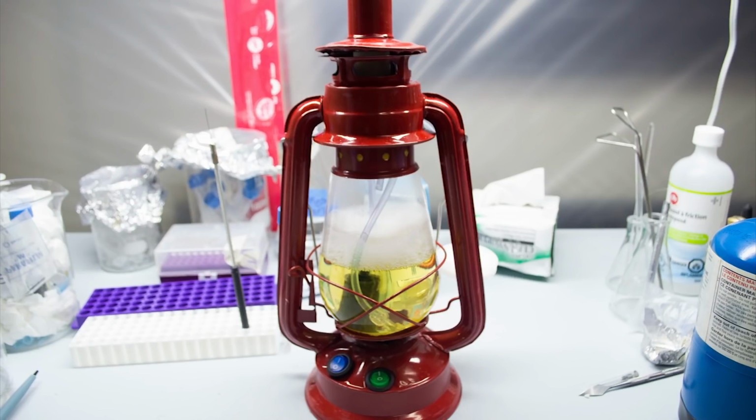And that's really all there is to it. These are exceptionally simple devices. I really overcomplicated it for the sake of the visual. But I think it was worth it as this looks amazing sitting on the desk in the lab.